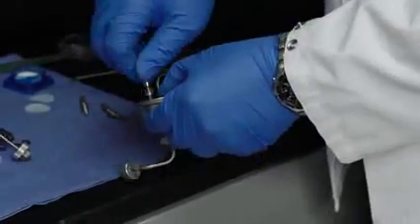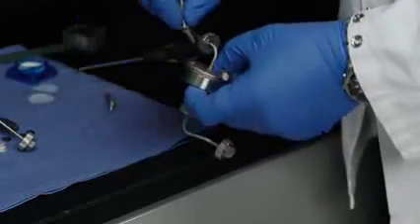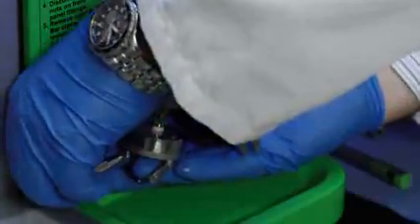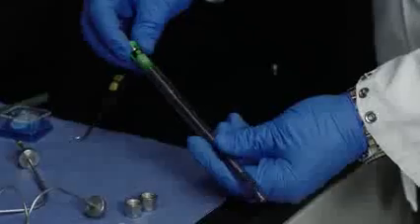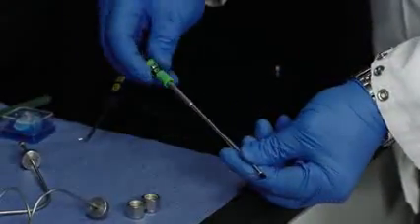The test section hasn't changed in the JFTOT 4. It uses the same heater tube as previous generation JFTOT instruments. You can easily recognize the heater tube components.